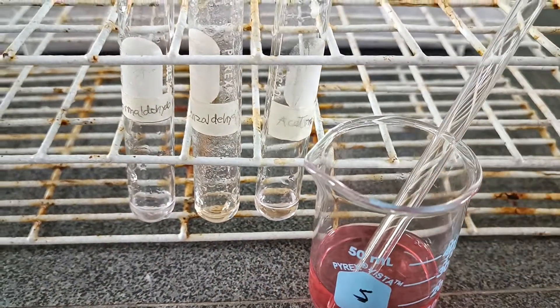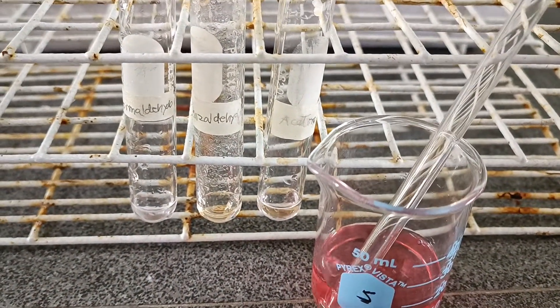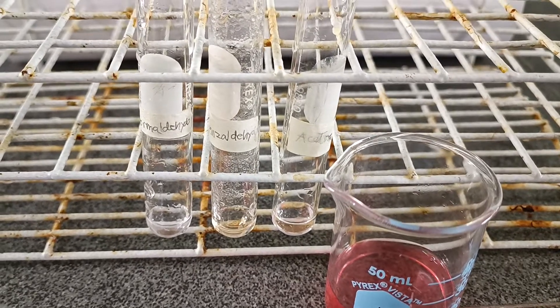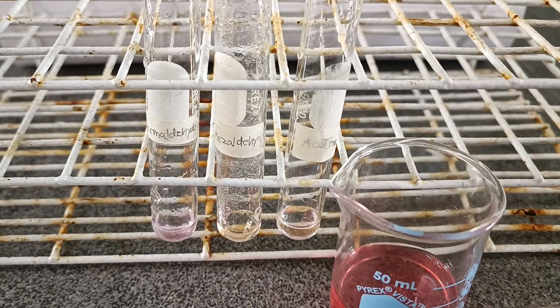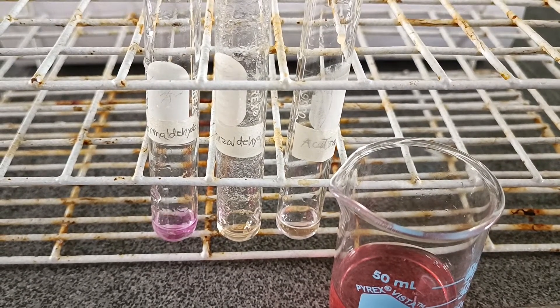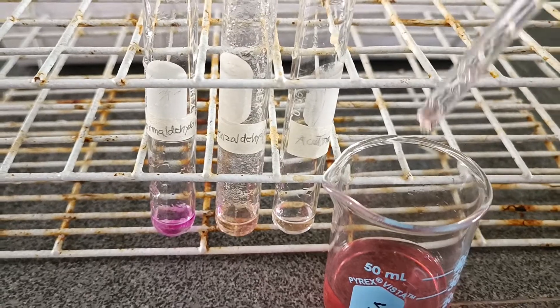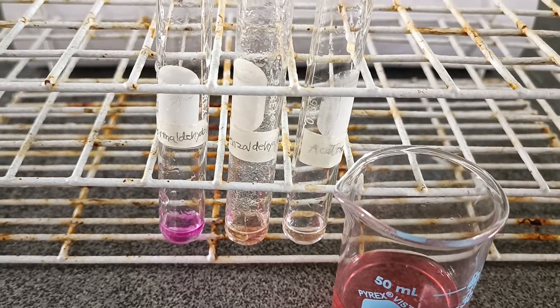And this is the Schiff's reagent. All I need to do is put in a few drops of the Schiff's reagent into each sample and observe the color change.